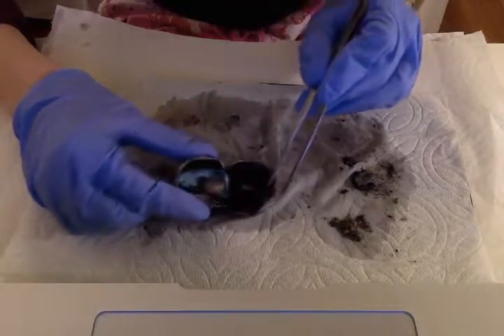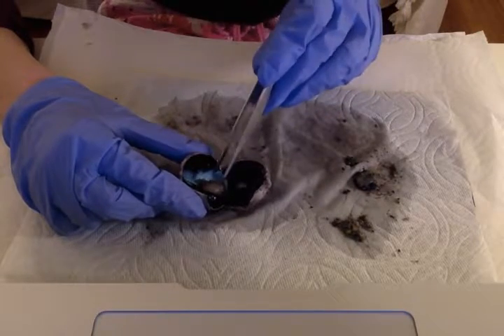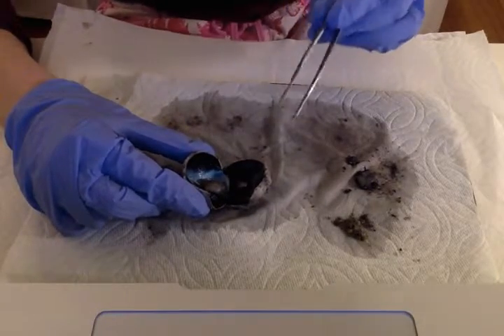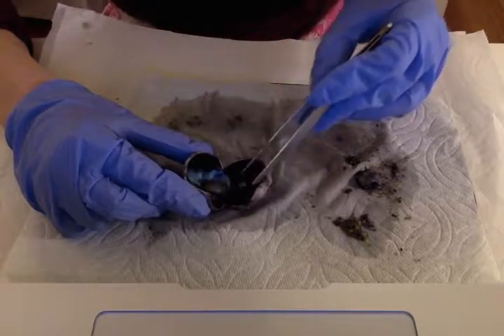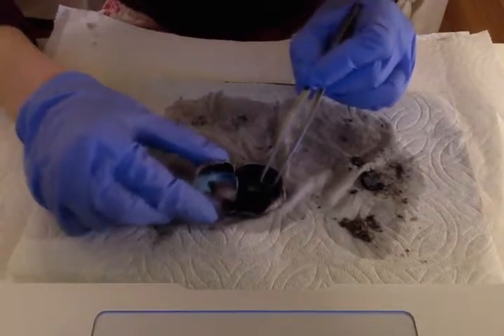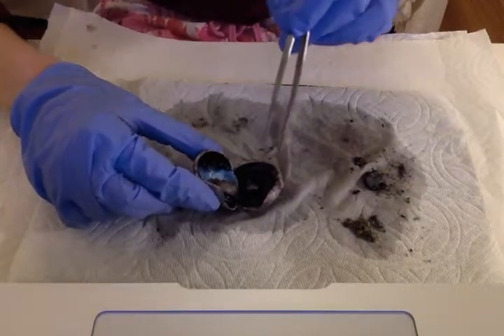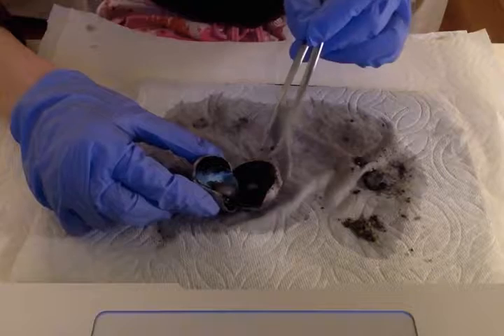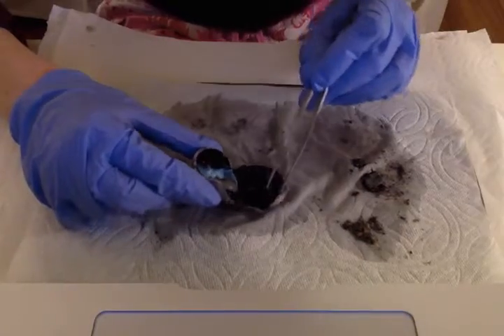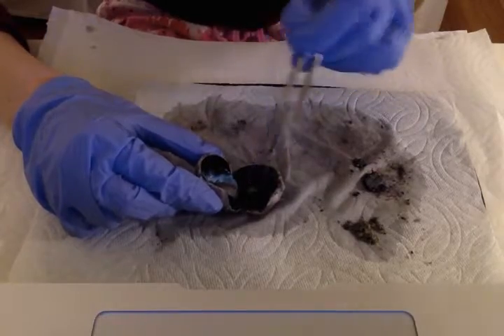Okay, so now the iris. I'm not sure how well you can see this, but the iris is right in here. It's a circular disc in front of the lens. That's the lens right there. The iris controls the amount of light that enters the eye, because it's attached to muscles that dilate or constrict the pupil, which is the opening. I don't know if you can see it right there, a clear little opening in the middle of the iris. The color of your eye depends on how much of the pigment melanin you have in your iris. The more pigment you have, the darker your eye color will be. In this dissection, like I said, it's this black circular disc right here.